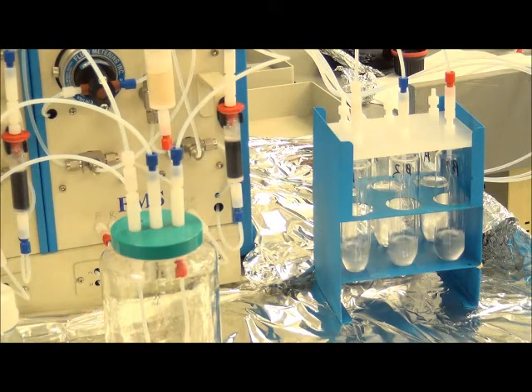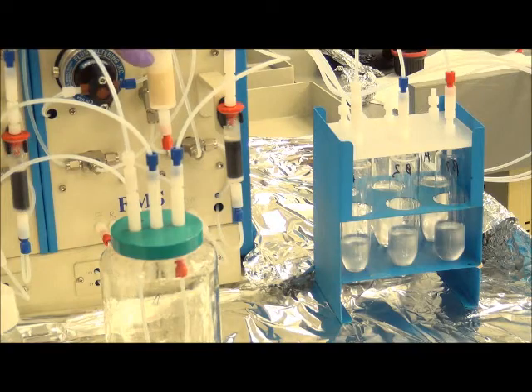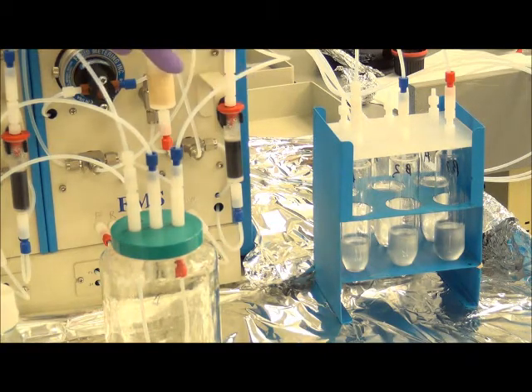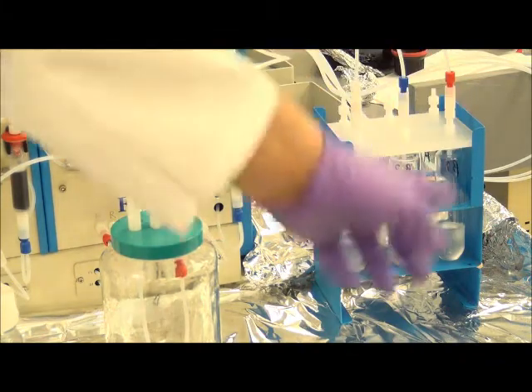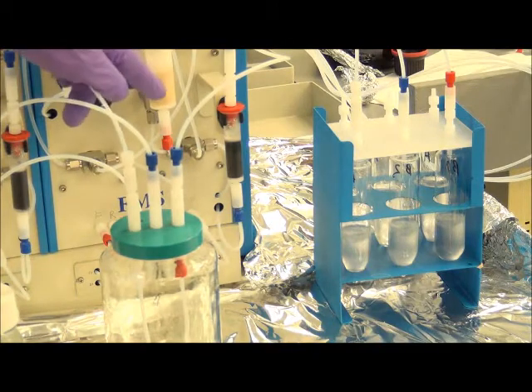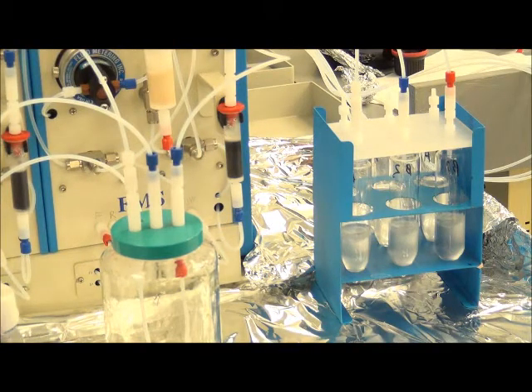And it'll now begin eluting the mixed bed cartridge, again with methylene chloride, and adding it to fraction 2. Here's the methylene chloride beginning to introduce, and then again combining to the same vial as the coconut charcoal. After elution, it'll purge each one again with nitrogen as it did in the first elution, and empty it into the same vial. So after 20 mils of elution, it'll now do the nitrogen purge of the mixed bed, followed by the coconut charcoal cartridge, and fraction 2 for basic compounds will be complete.